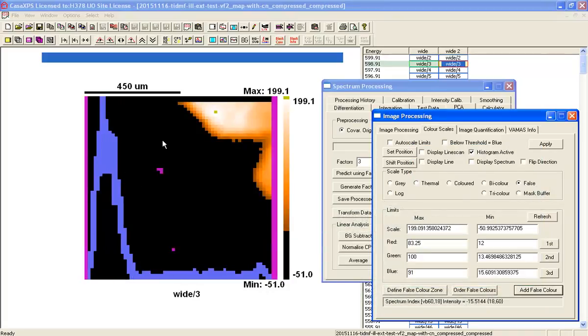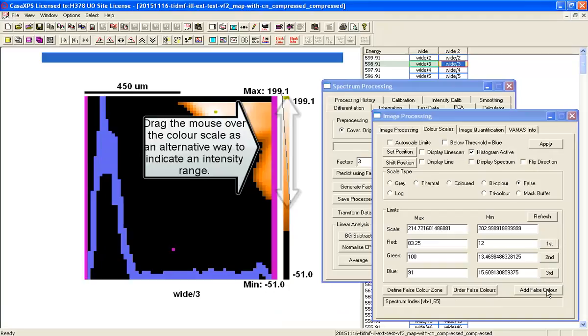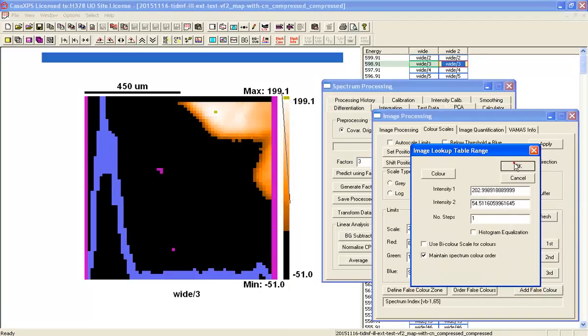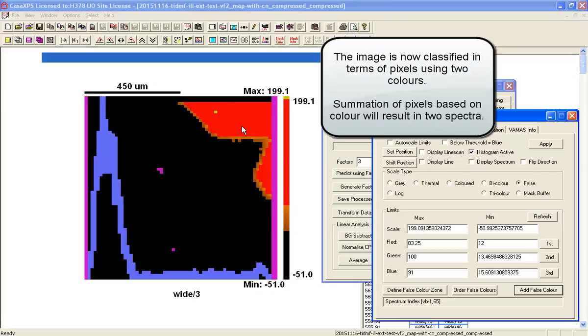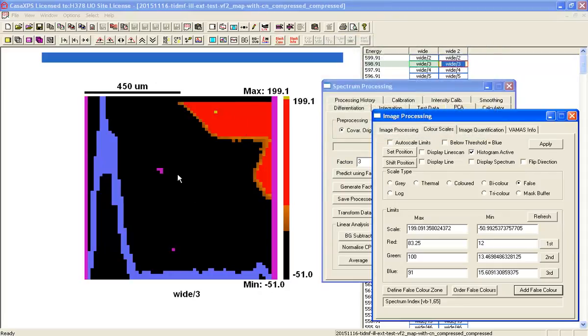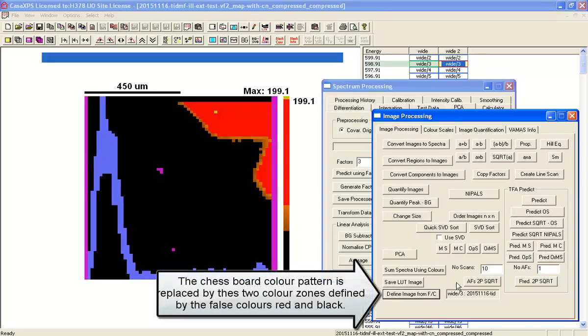So this is one phase that I'm interested in, and the next phase I'm interested in is what's up here. So let's just mark out using the color scale a range, and so now I've got pixels colored red and I've got pixels colored black, because all we're interested in is summing spectra from these pixels and spectra from these pixels, and to see what the differences might be between these two zones. So I'm going to go to the image processing. I'm going to define the image using this mask that I've got defined.